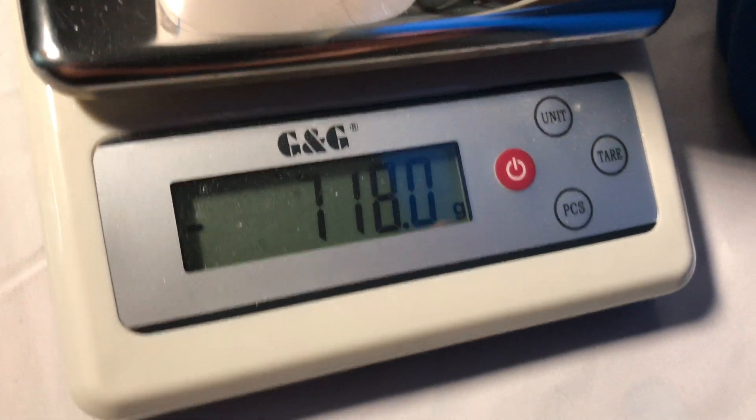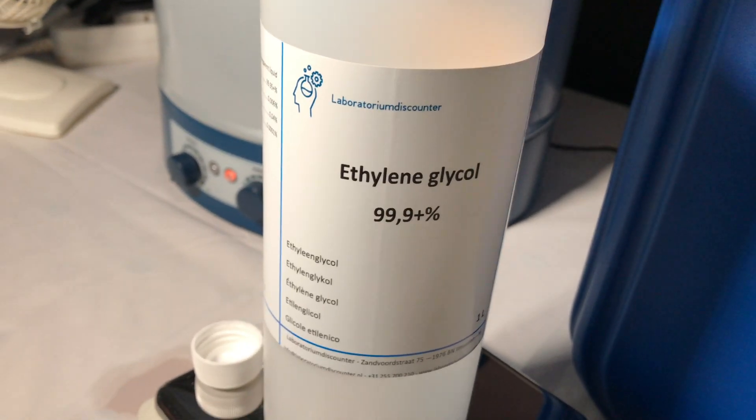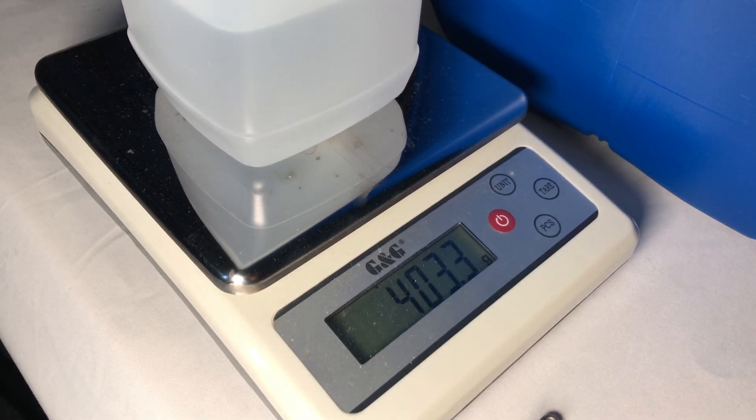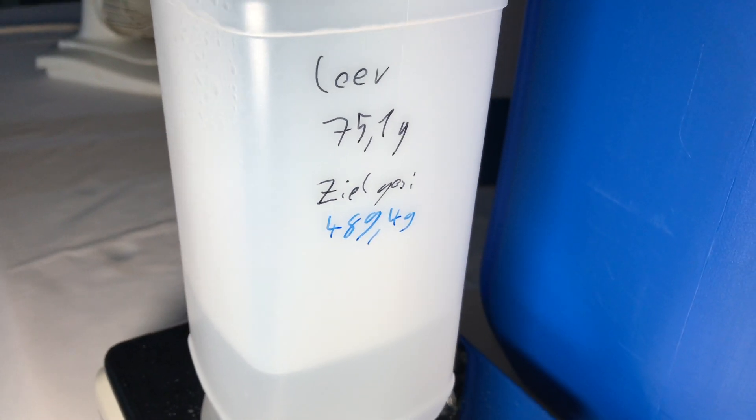In the beginning of the video I only added ideal amounts of ethylene glycol, but too much is not going to hurt and it's actually going to improve the yield. Therefore I later on added the 700 and something additional grams.